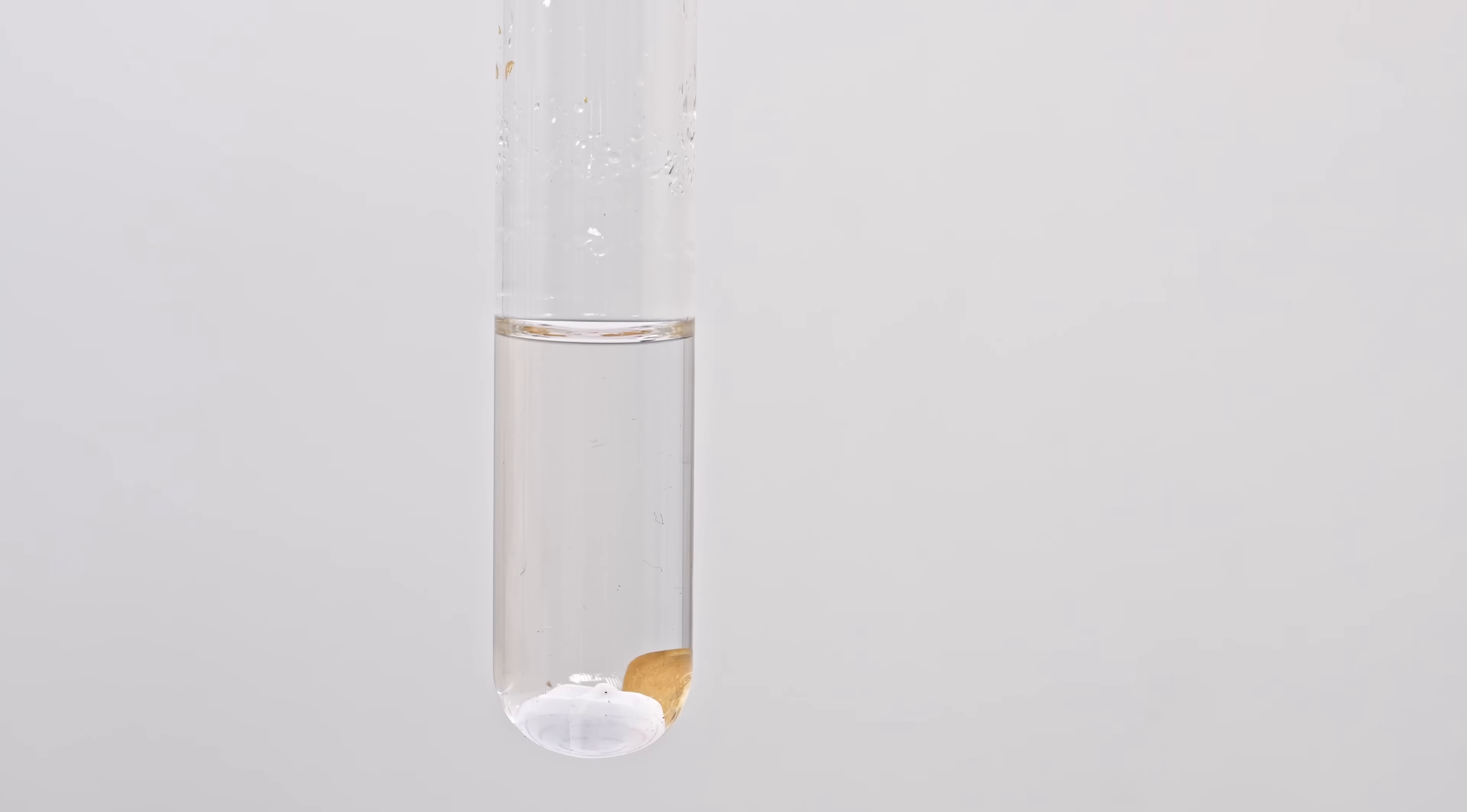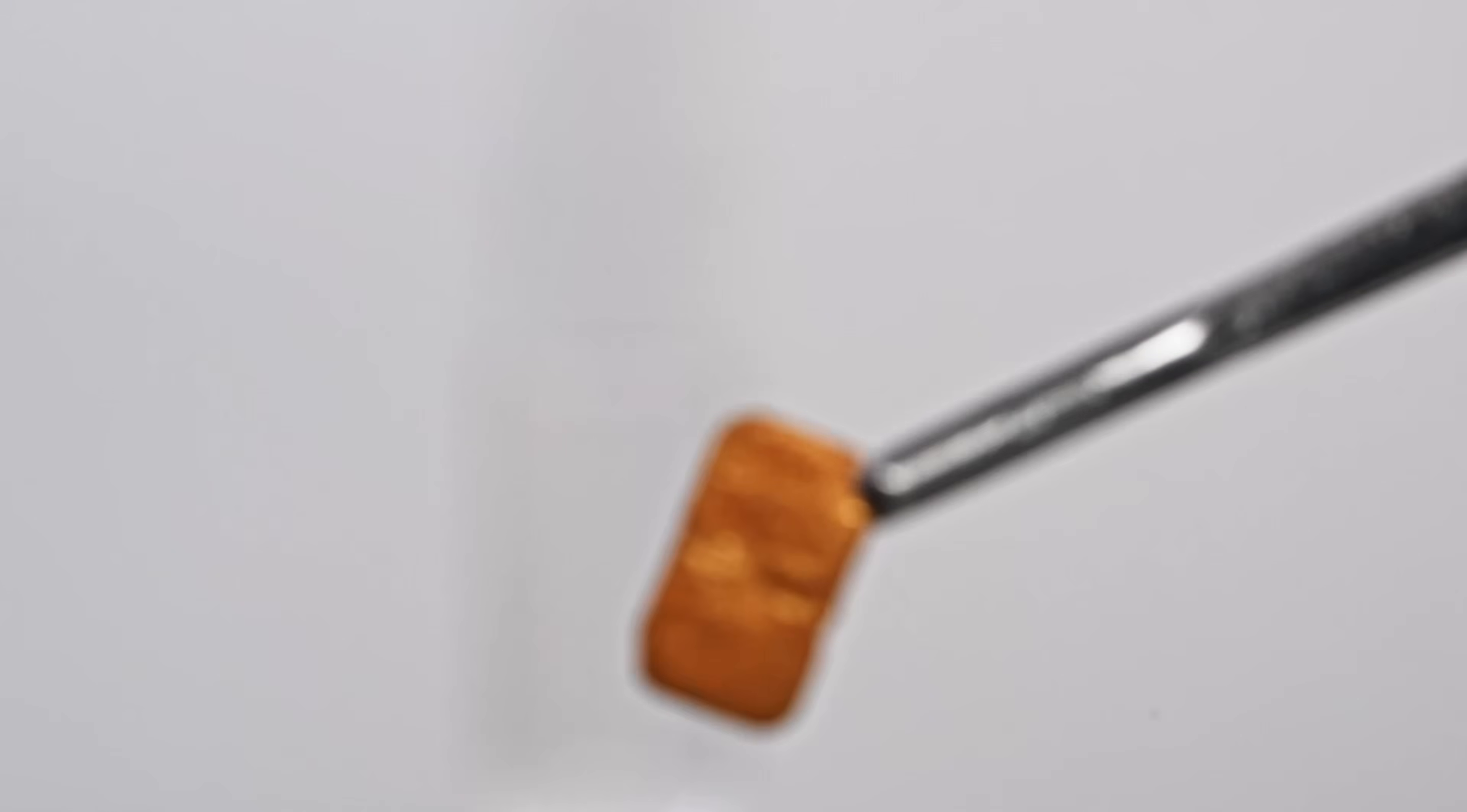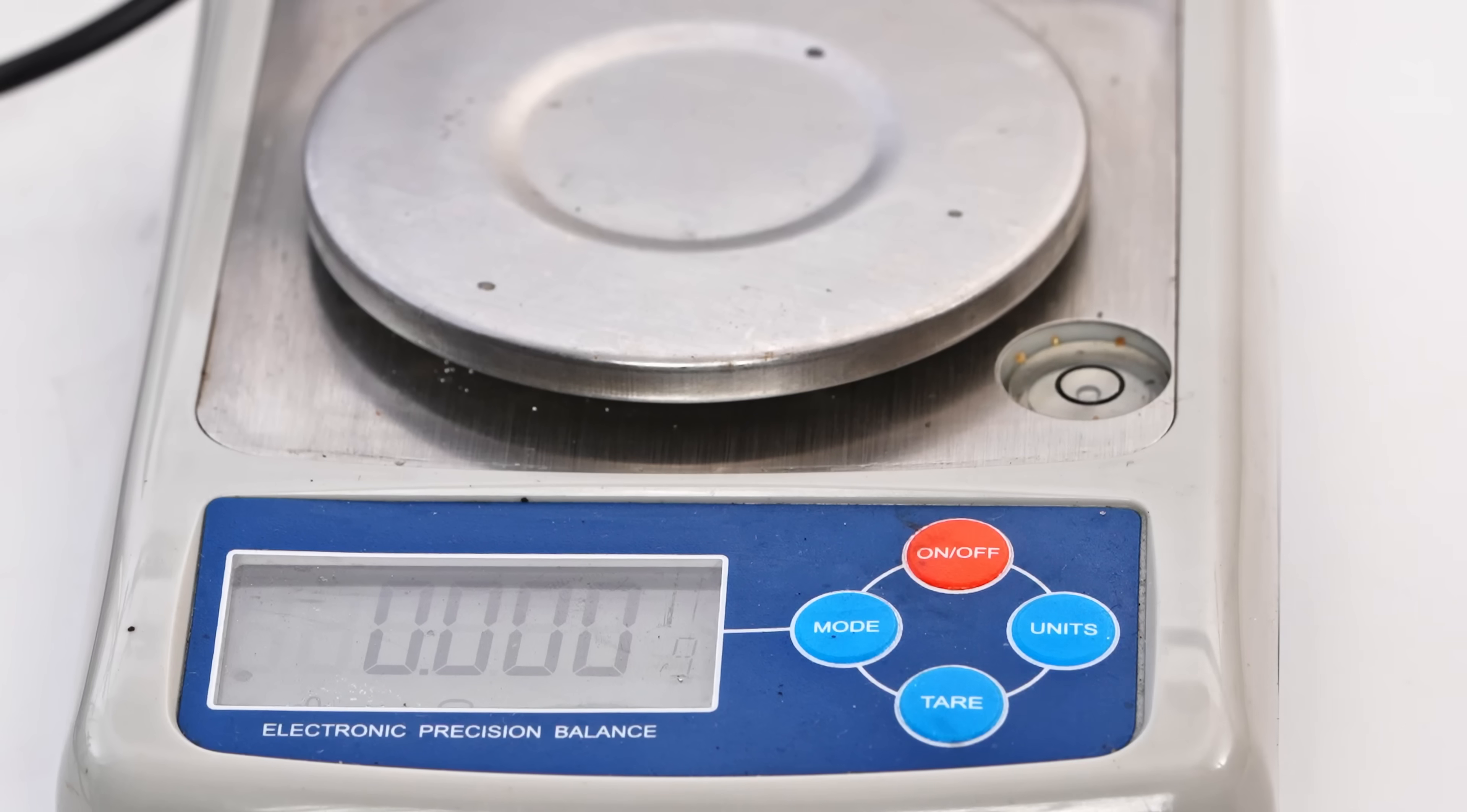I continued the process, but the dissolution slows significantly. Our gold ingot had noticeably lost its original appearance, but had lost almost no weight, only 2 milligrams.